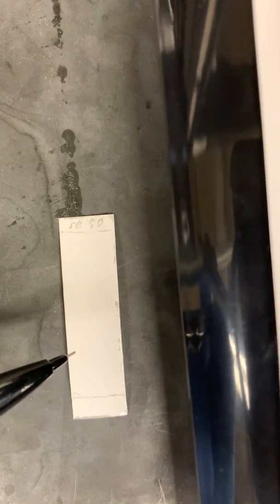What we want to do is circle these spots with pencil, because when we turn the UV light off they aren't visible on the TLC plate anymore — well, they are, but you can't see them. By circling them with pencil you always know how far each compound traveled up the TLC plate.